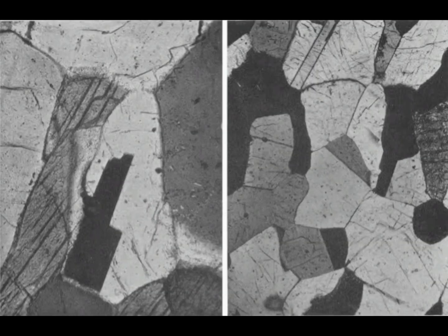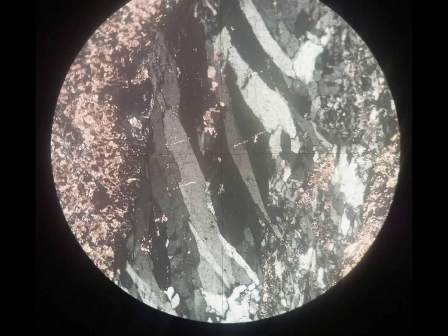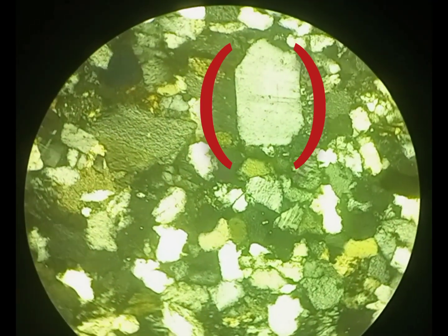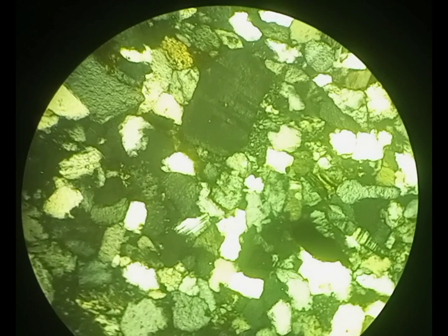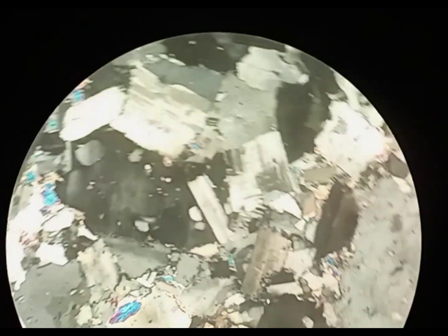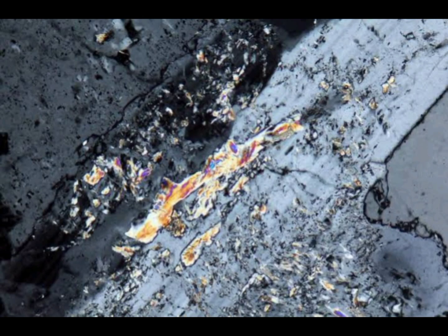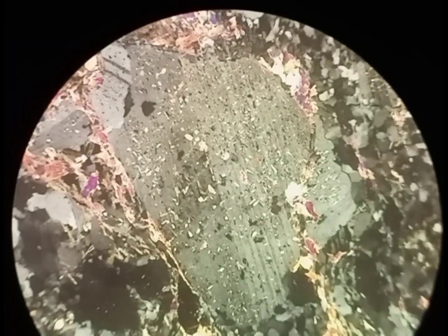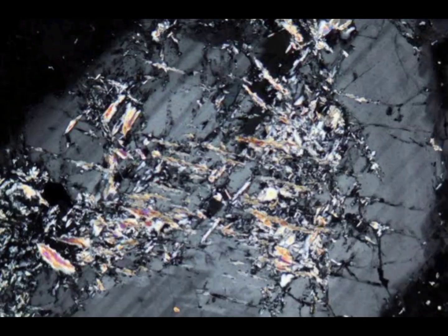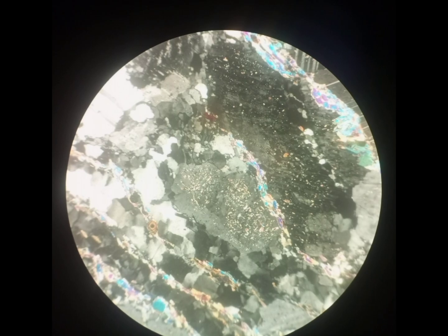An untwinned grain of feldspar can be confused with quartz because they have almost the same interference color and almost the same relief. However, we can differentiate an untwinned feldspar from quartz using different criteria. First, in cross-polarized light, the surface of feldspar is often altered into mica.